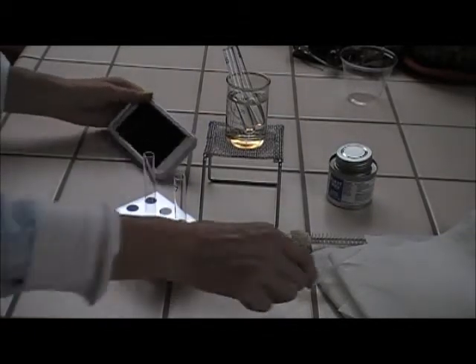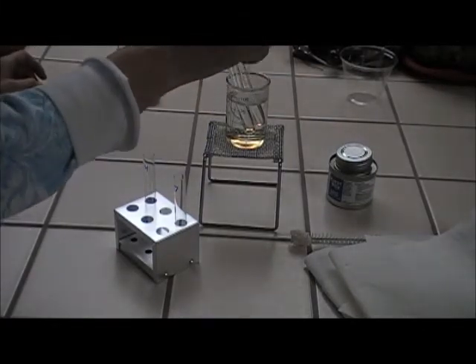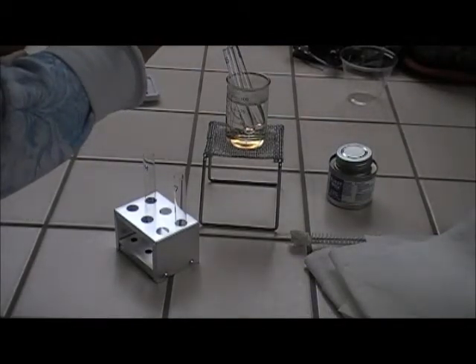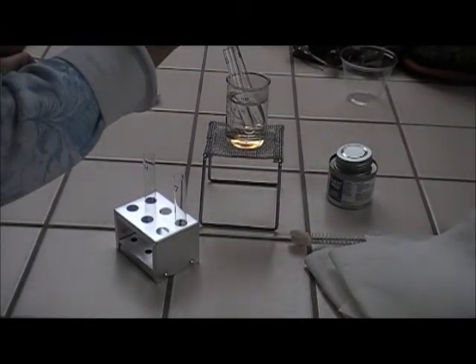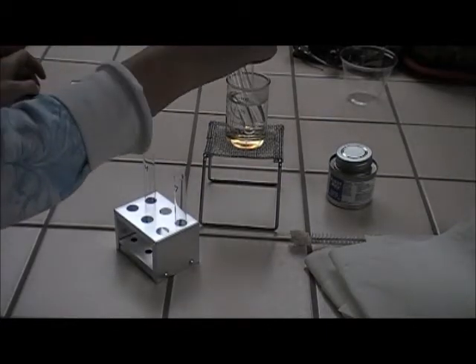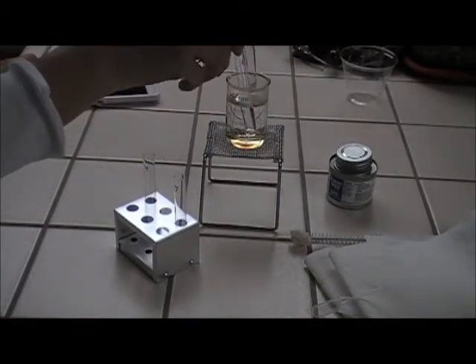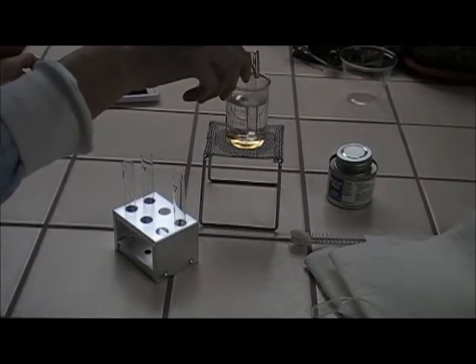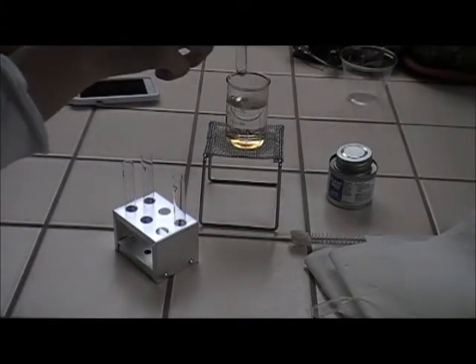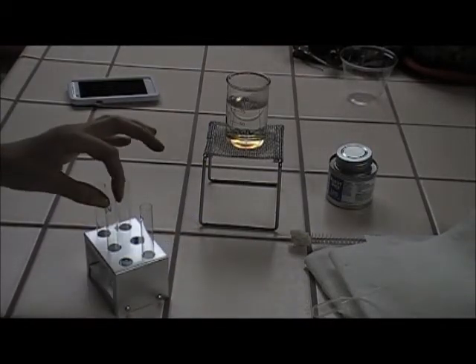Alright, time's up. So it calls for 20 drops of water into each test tube. 1, 2, 3, 4, 5, 6, 7, 8. Alright, 20 in there. Alright, and 20 in that one. So I'm going to pull them out, agitate them a bit, put them back in the stand, agitate it a bit, back in the stand, and let's see if my prediction is right.